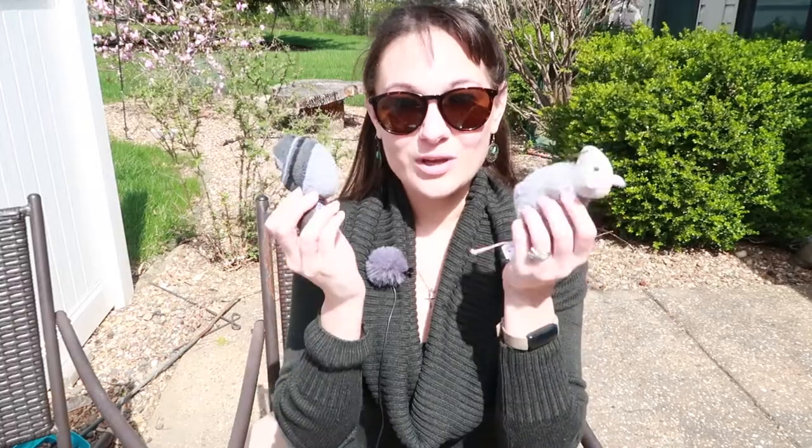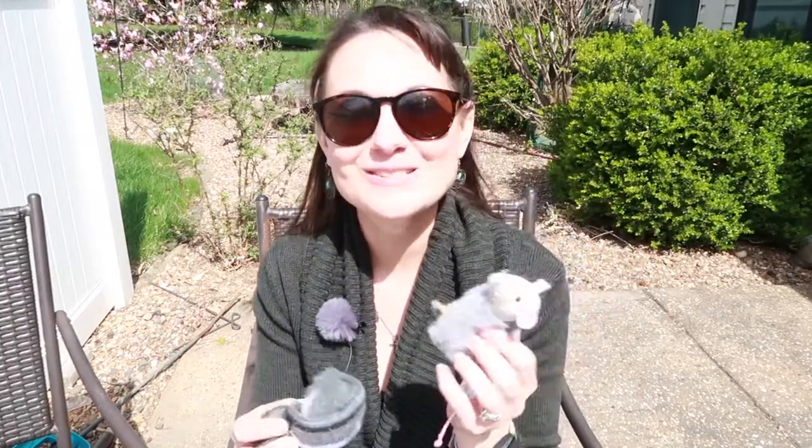It's a good idea for something like this — same with the blow method — to practice, especially if you're new and you're just not sure about doing this. Kind of getting a feel for it, but not doing it on an actual bird, is really helpful. So in this demo we have some props, and that's what we're going to be using.